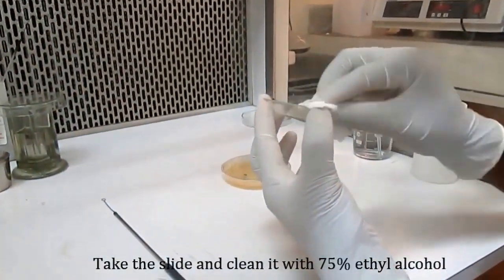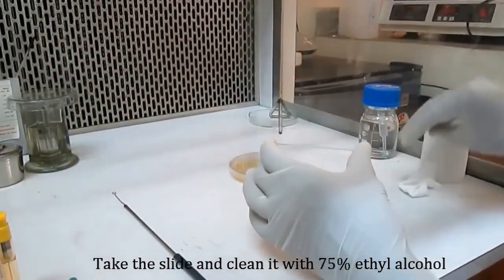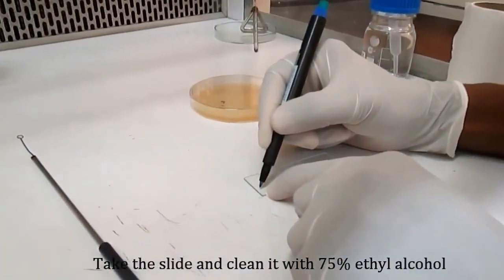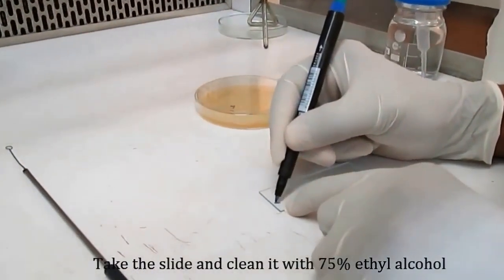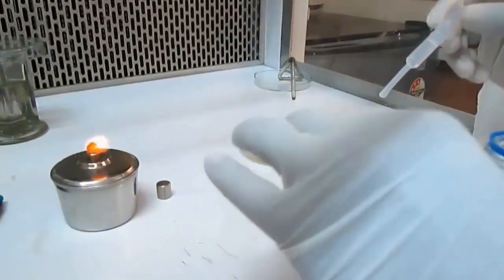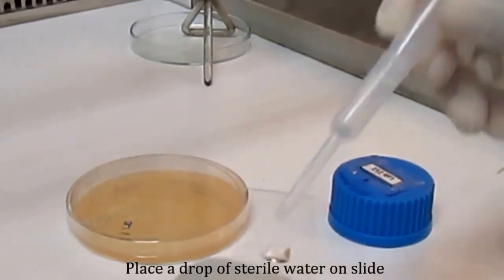First of all, take a clean glass slide and wash it with 75% ethanol in order to remove all the contamination on the slide. Then mark the slide with your initial in order to identify your slide. Then place a drop of water on the slide.